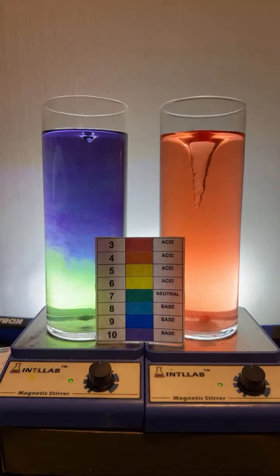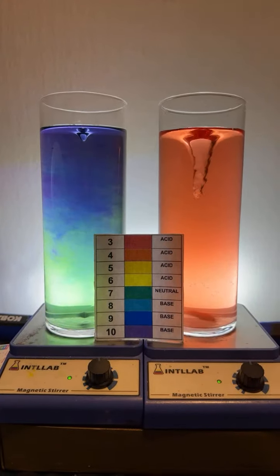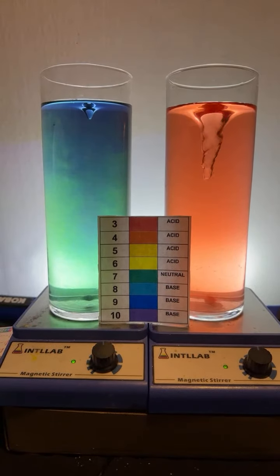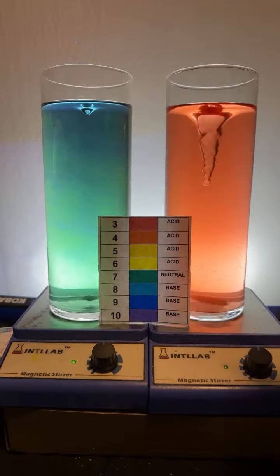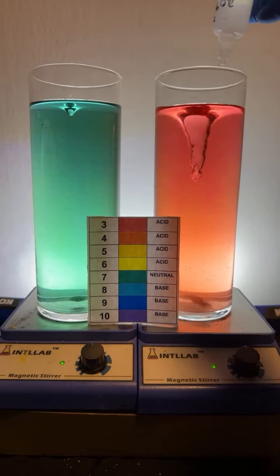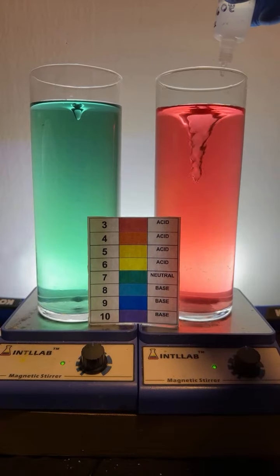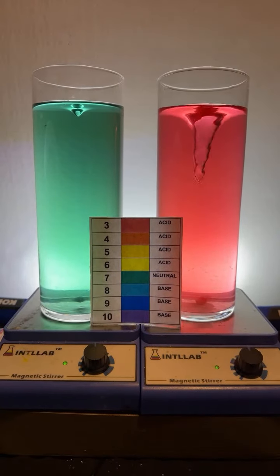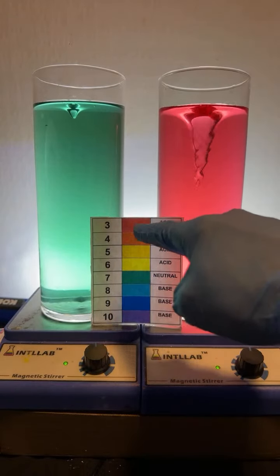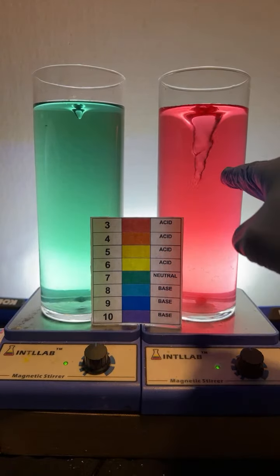Could you mix an acid and base? I'd like to see the color of that. Sure we will, Moss. This is a fun experiment. I'm glad you asked. So we're going to do this experiment for Moss. Let's see. All right, I'm going to add a bunch of acid over here on the right-hand side. So notice as I add the acid, the color shifts to red. The pH lowers, right? We went from an orange color to a reddish color. The pH drops as this gets more acidic.